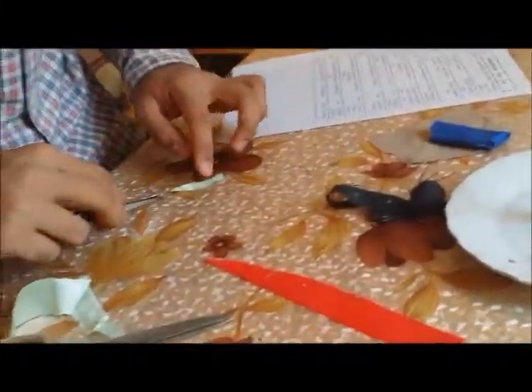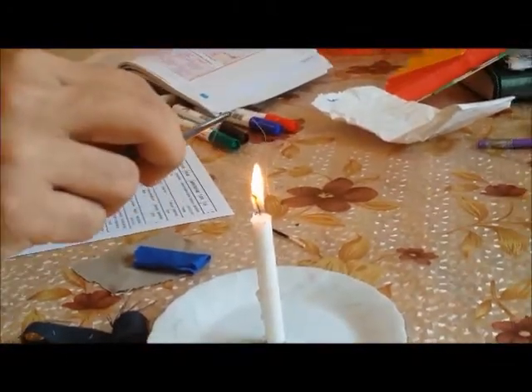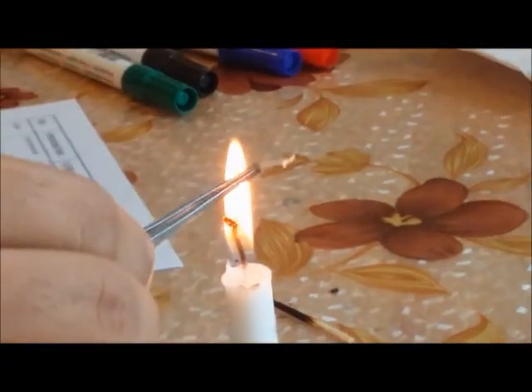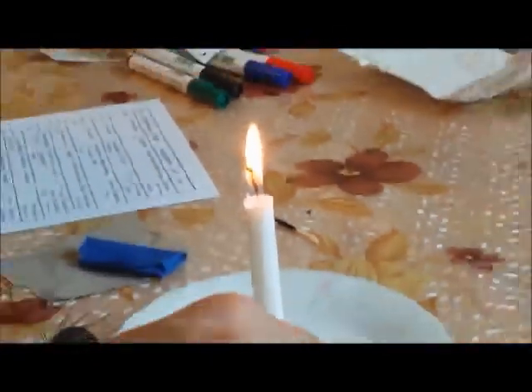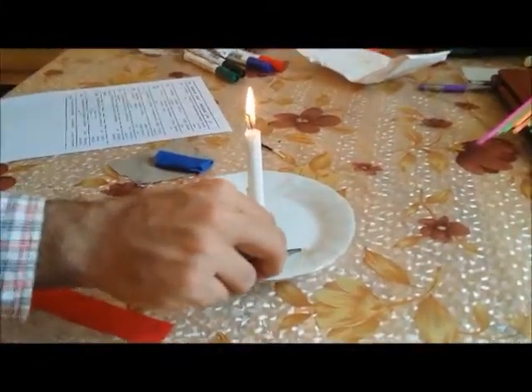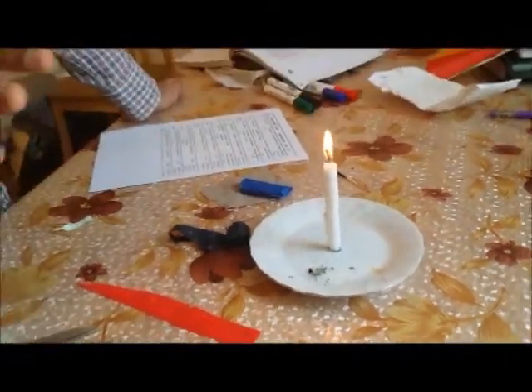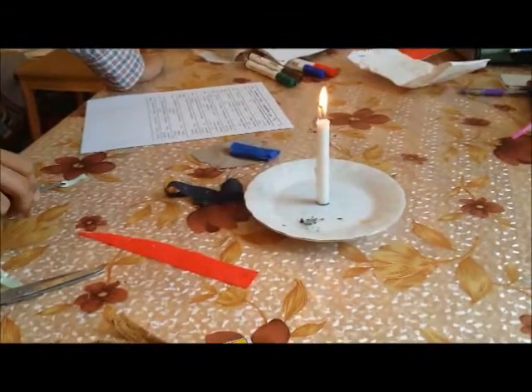Let me show you once again. It's a thread, brought near the flame — it doesn't burn, it just curls up. You can see curling — these two curling. When it curls, we still can't conclude anything. So let us see how does it burn.